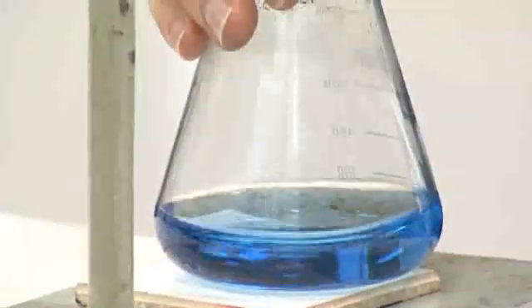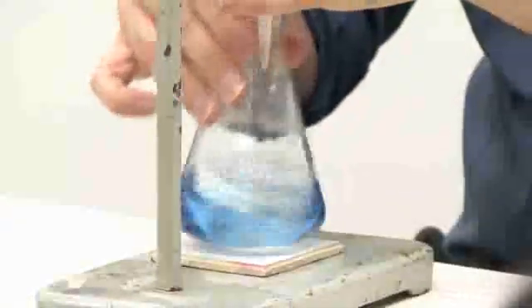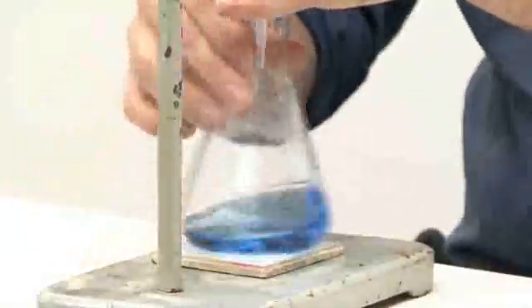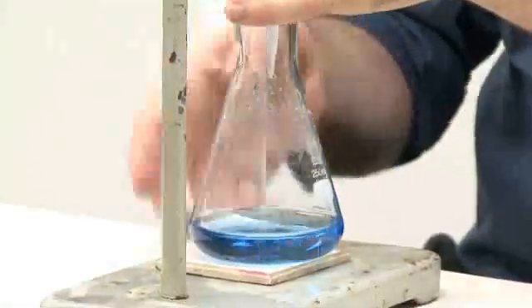Now this is a rough one. We're at 20 and a bit mils. So the first one is always rough. To give you an idea of what the end point should look like anyway. So you add a small amount, small squirt, swirl. You'll note after a while, you add it and the yellow stays there longer and longer. We're really getting close to the end point now.